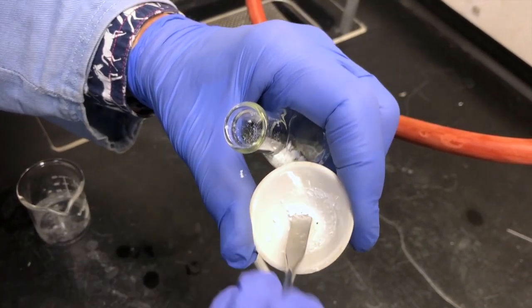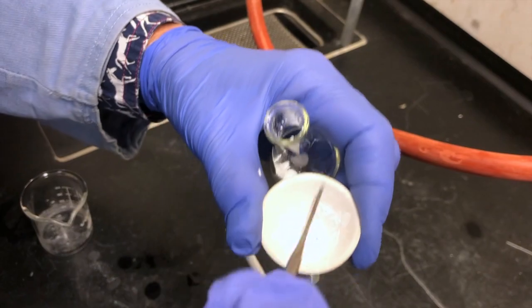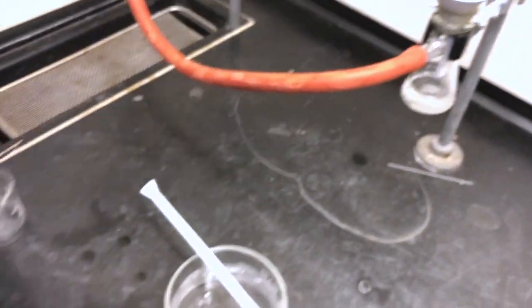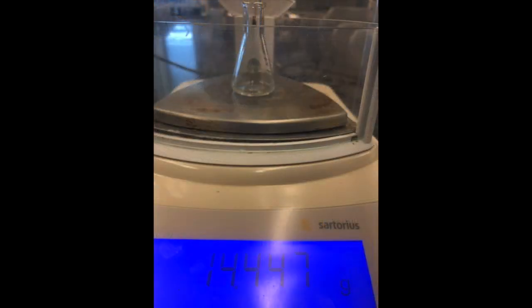I think that's the part that we saved for the melting point. Or the part that's on my thumb. Once you've got out as much as you can from the filter, you should weigh the crude product in your Erlenmeyer flask. We also took the empty Erlenmeyer flask mass previously. This means you will be able to get the mass of the crude product by difference.